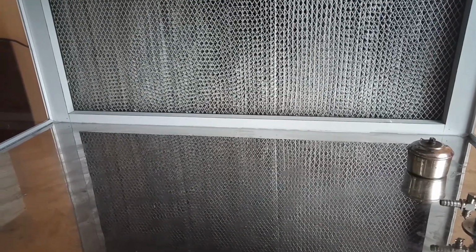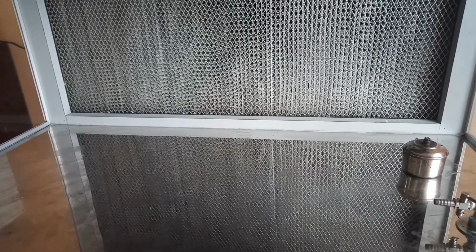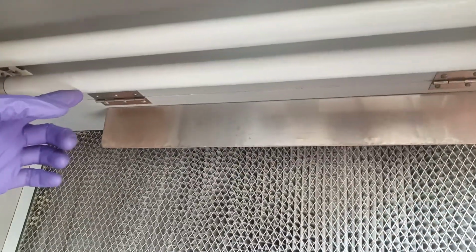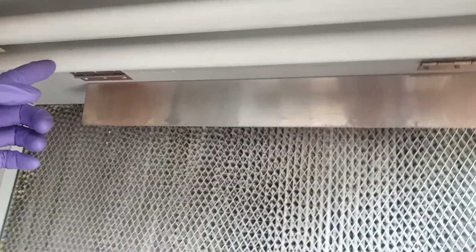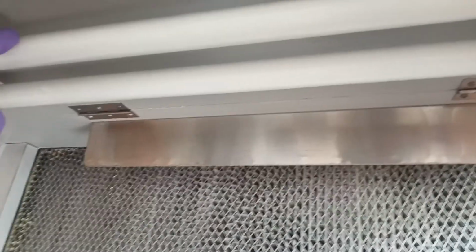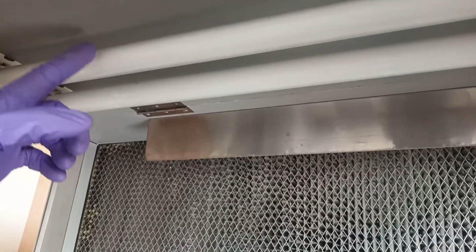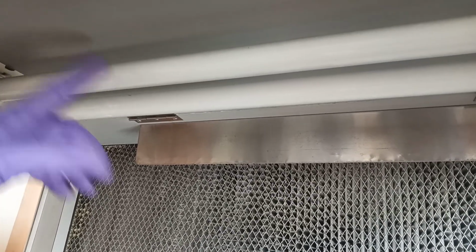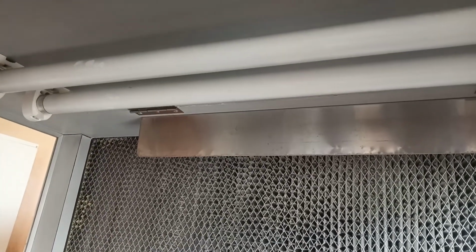To ensure that, at the beginning we need to sterilize the entire hood. For that we have a tube. If we look on top here, we have a UV tube and also a working tube, which is a normal tube that helps us during functioning. The UV tube is switched on before starting the work inside the laminar hood, and this UV radiation kills all the microorganisms present inside the hood. And there will be a blower.